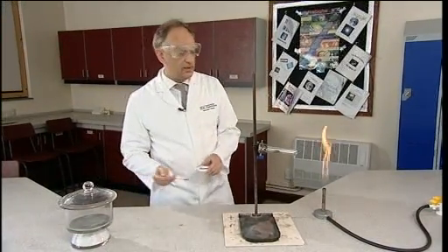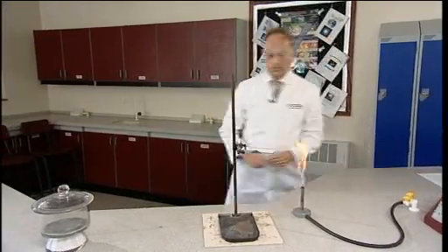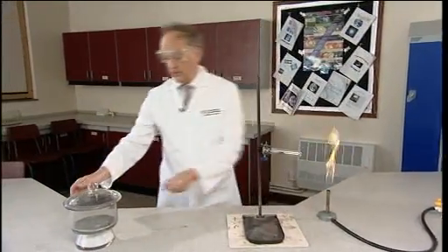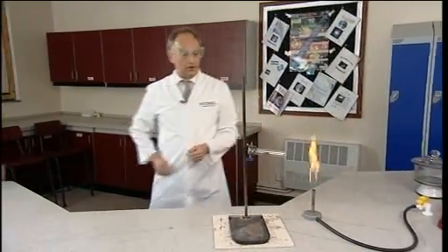The mixture is now going to be heated with a roaring Bunsen flame, and it's useful if you're doing this in front of an audience to have a safety screen between you and the audience.